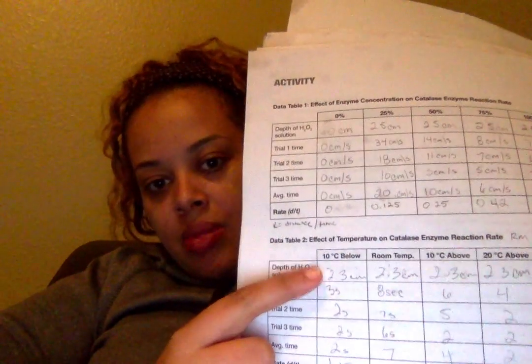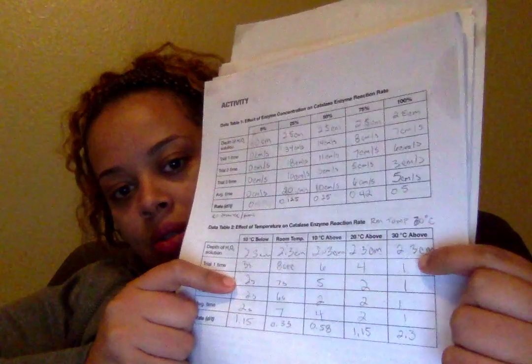That seemed to be the most optimal in speed. Even though it did speed up at 10 degrees below room temperature, it was still much better at 30 degrees above. So it seemed like the higher the temperature increased, the better the reaction rate became. The slowest for this one was at just room temperature.